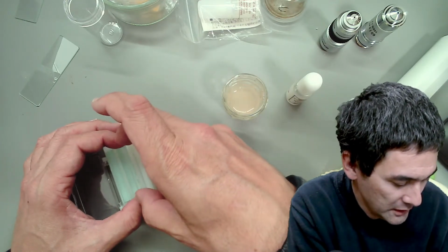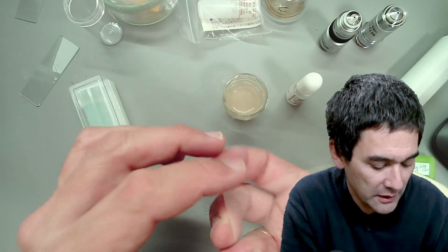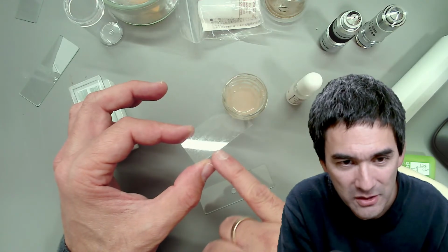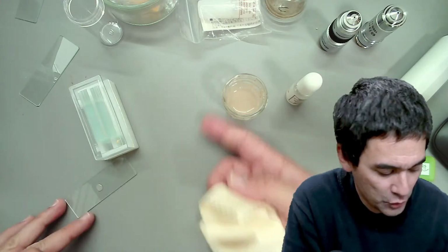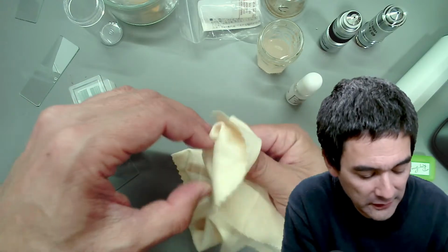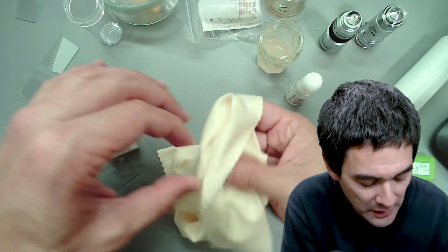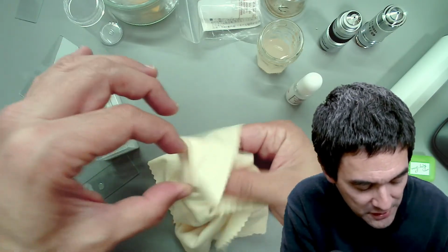It's a little bit annoying, I have to tell you, that those cover glasses are not entirely clean. They're pretty dirty, actually. You see, if you let the light reflect, there's some smear, even though they're fresh out of the box. So what I usually do is I dry wipe them. This is a microfiber cloth for cleaning glasses, but you can also use regular tissue paper. I found this to be enough. No need to actually wash it in water or alcohol. At least for my purposes, it's fine.